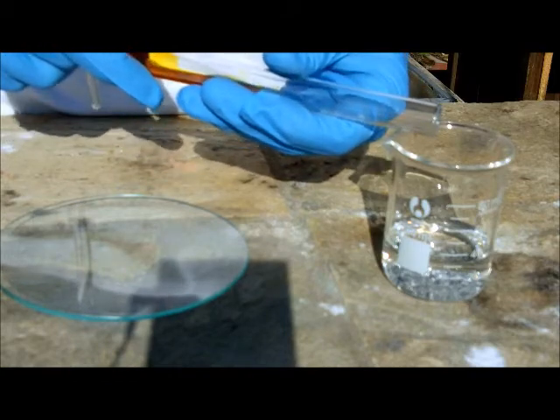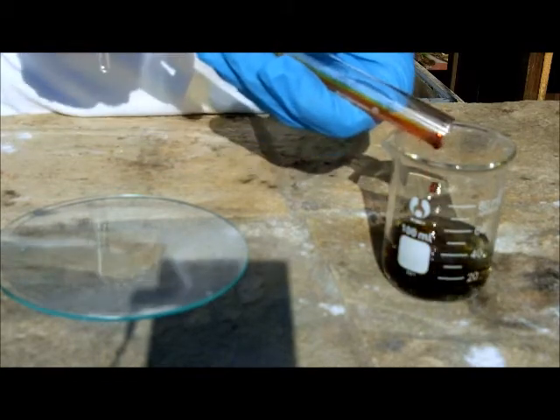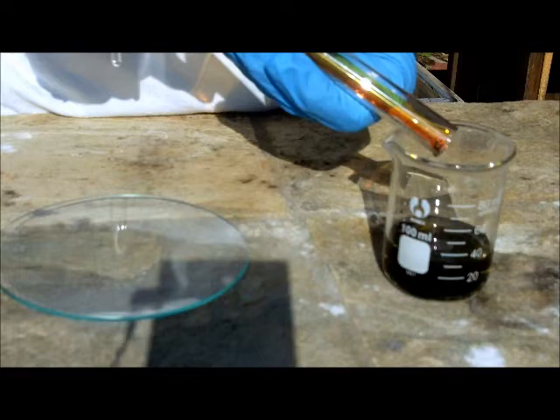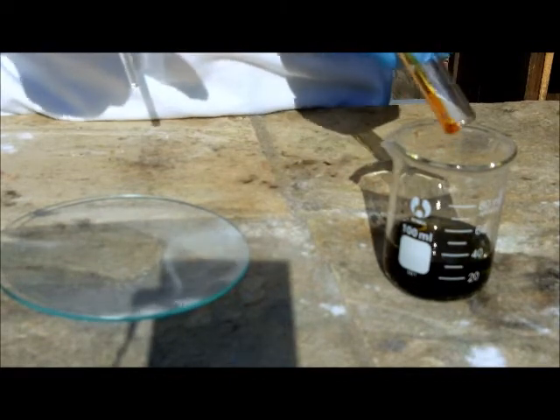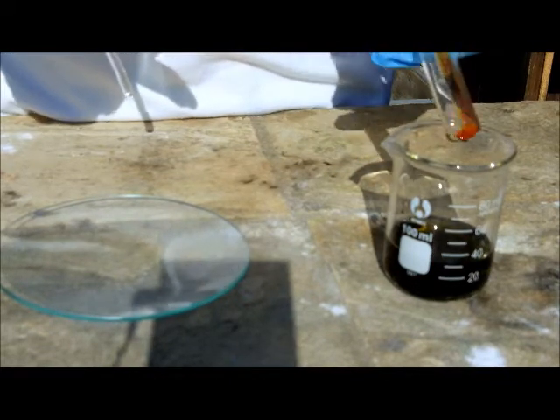Pour off the remaining liquid into some sort of aqueous reducing agent to safely reduce it. I'm using sodium thiosulfate solution. You can see the color change from red to green.